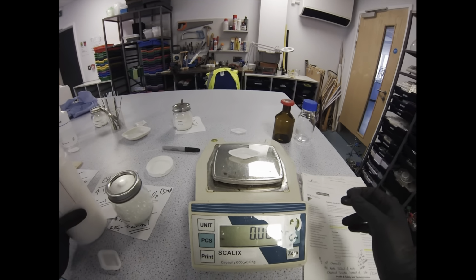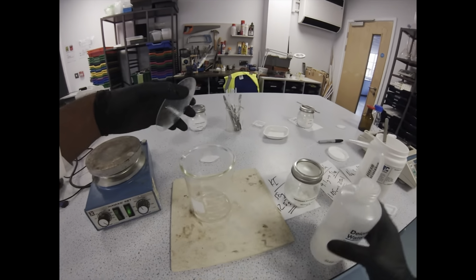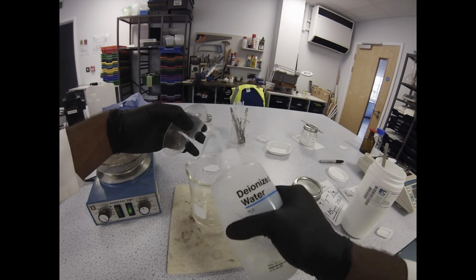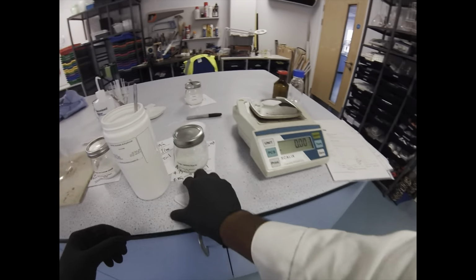So we'll do the rest of our powders, but I'll just take the beaker off the heater. Let that cool down. So I'm going to add some water now. Now that's on the heat-proof mat to let that cool down. Being fairly generous with the water because I'm going to try and dissolve more powders in there.